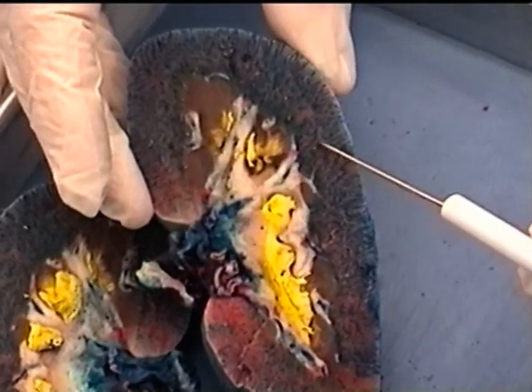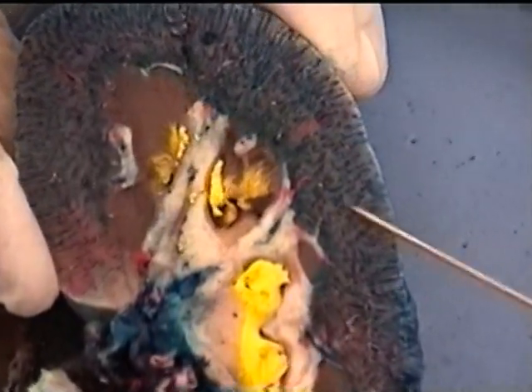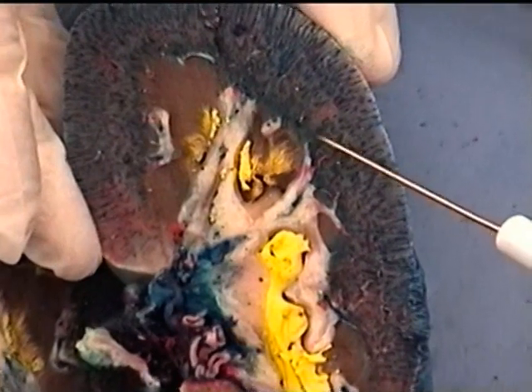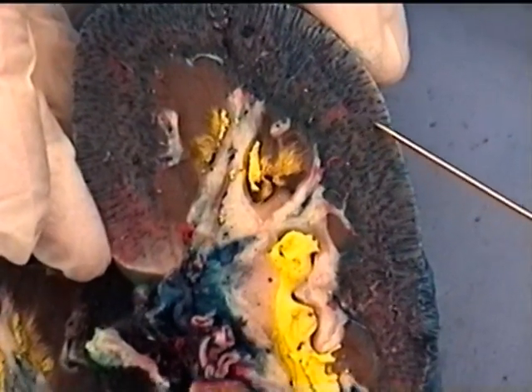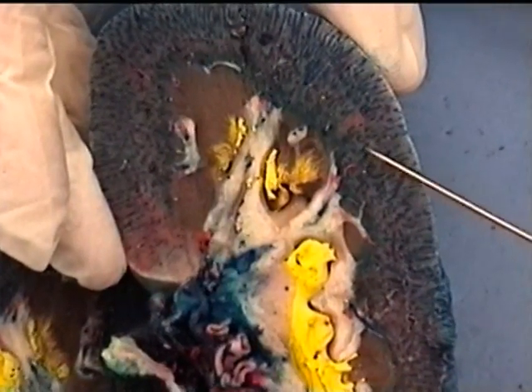So all of the blood vessels we're seeing out here, the little red ones like this, are arteries, and the blue ones we're seeing are veins. So those would be the interlobular arteries and veins going out to those renal corpuscles where filtration would occur.